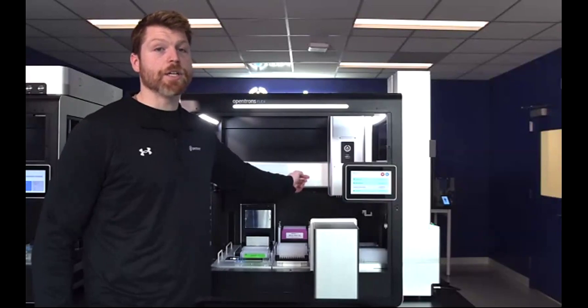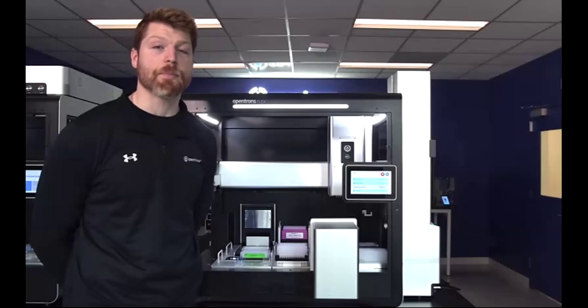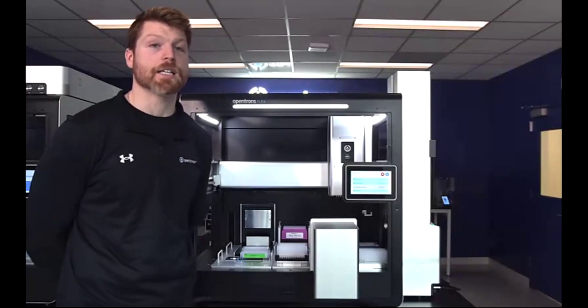Also mounted to the gantry, over to the right-hand side, which will be shown as we go through this protocol, is the gripper. The gripper does not block any of the pipetting ports, so you can have this with any pipette configuration, and it has the ability to move SBS format plates around the deck. In this protocol, you will see it move across the entirety of the gantry.